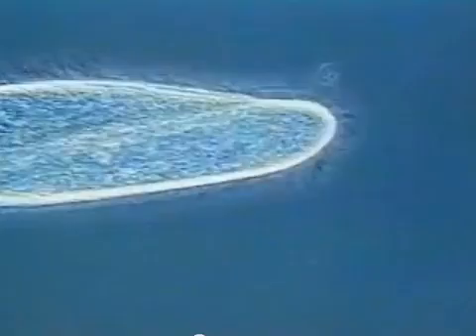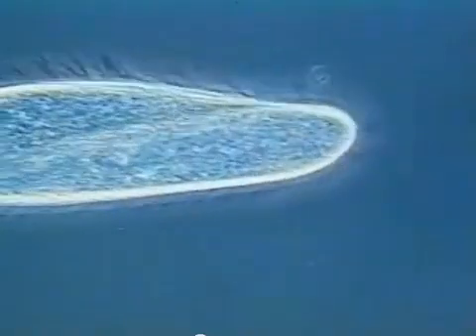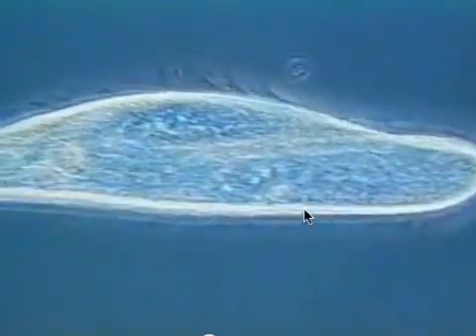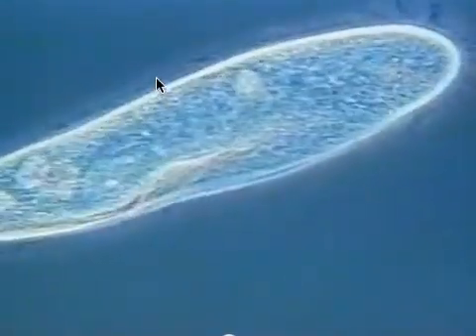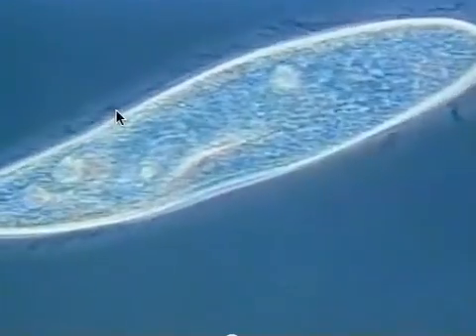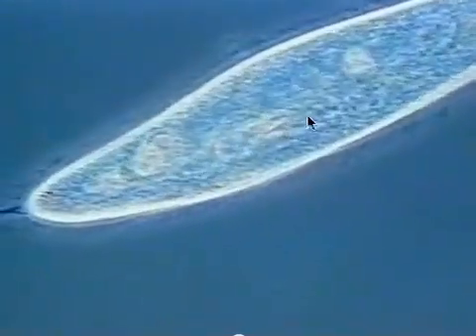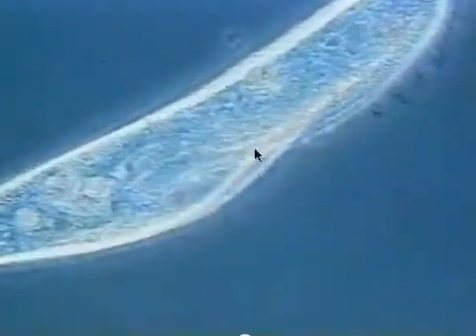The next one is paramecium. You can see these tiny hair-like structures along the outside — they beat them back and forth, and that's how they move. They're called cilia. You can also see the oral groove right here, and that's what the paramecium uses to eat.